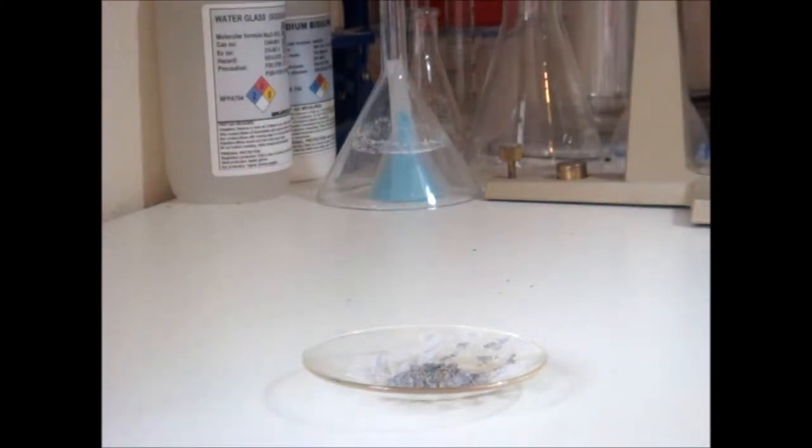Now I've added some water. Now we wait. Oh my god.